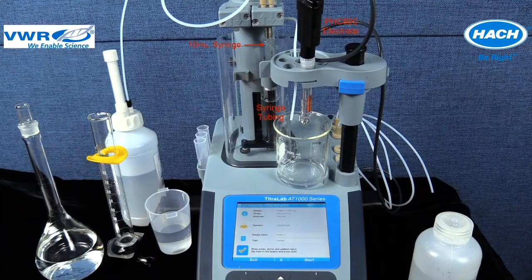The 10 ml syringe detailed in the application note has been installed on syringe port 2. The syringe port corresponds correctly to the location of the application on the second line of the display. The syringe tubing from the dispensing side, as seen with the blue indicator and upward arrow, is fed to the sensor holder.